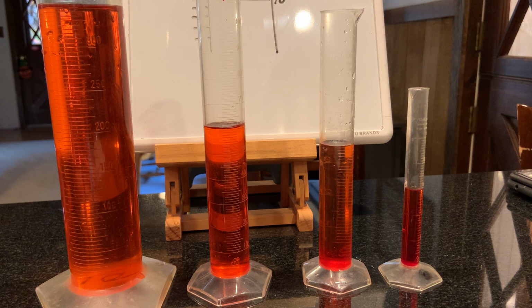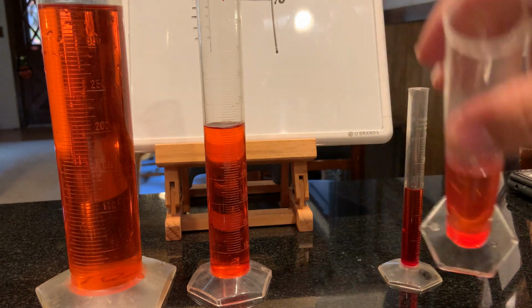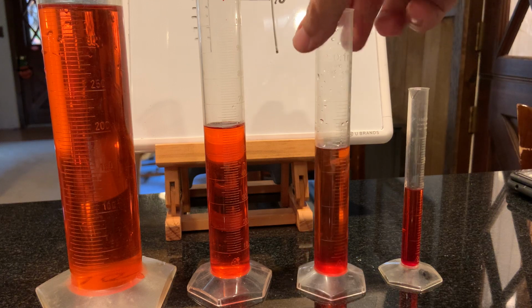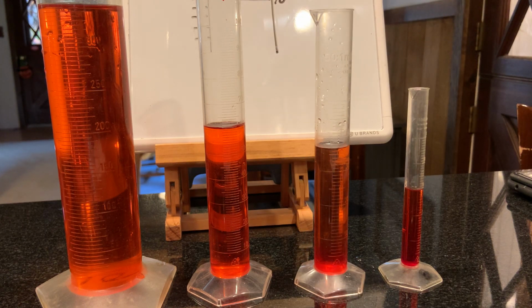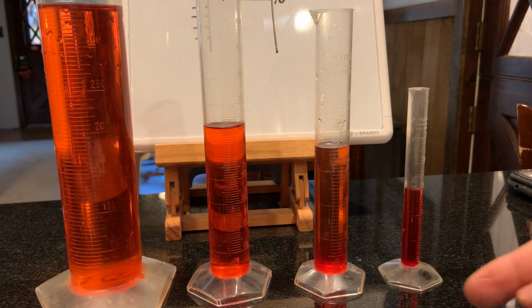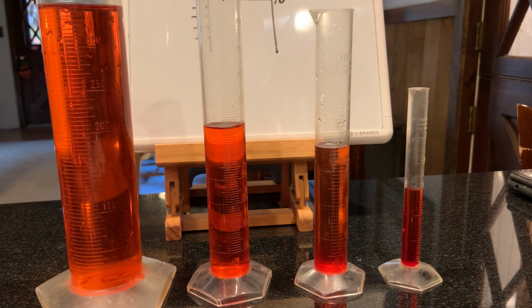All right, so first of all, they're called graduated cylinders. Cylinders because that is the shape of them, okay? So they're cylindrical in nature. And graduated means that they have these lines on them or these increments. Okay, so they're graduated in different ways. Depending on the size of the cylinder, it may be graduated by tens or fives or twos or ones or even 0.1s for the really small ones. I'll show you examples of those as we go.